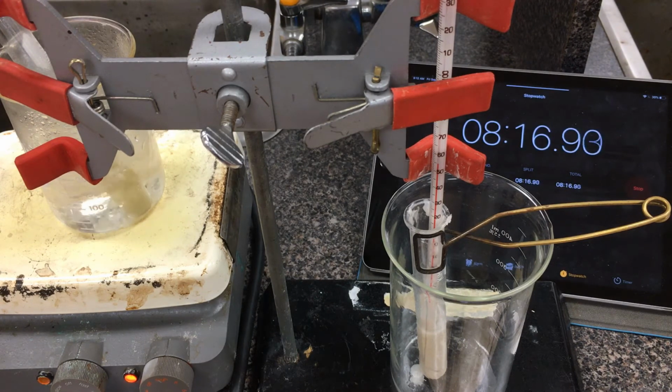Just for reference, we're still at 53.5. And one last reading here, 53.5. Thanks, guys.